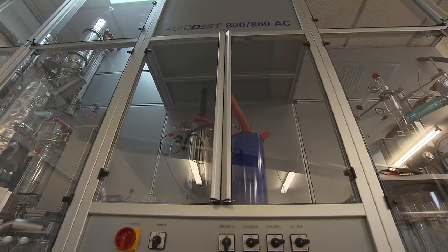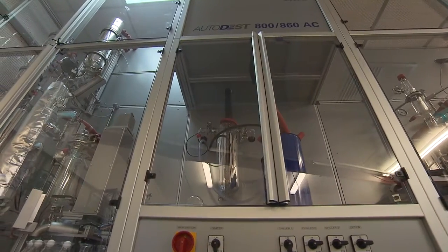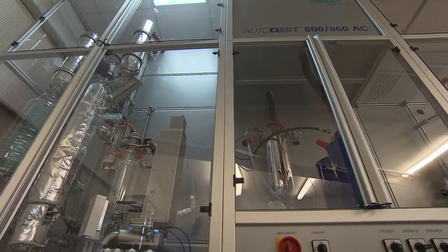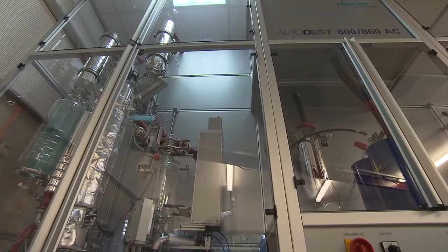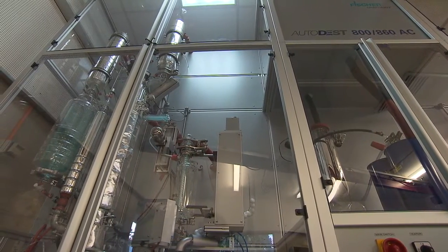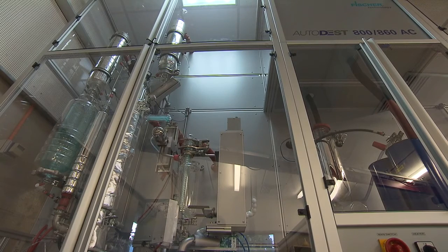IPL offers full crude assay testing capability. We have two Fischer distillation units enabling us to offer flexible and competitive packages that can be tailored to meet your needs. These range from a quick low-cost rapid yield analysis to a full crude assay.